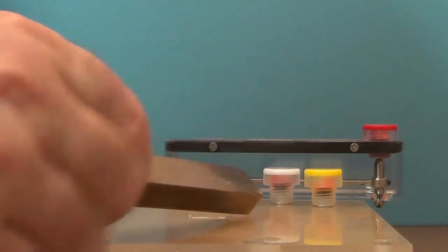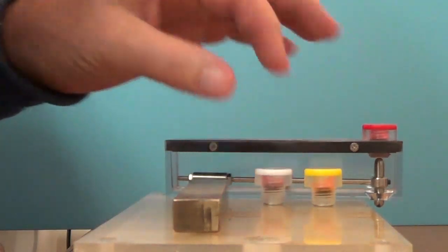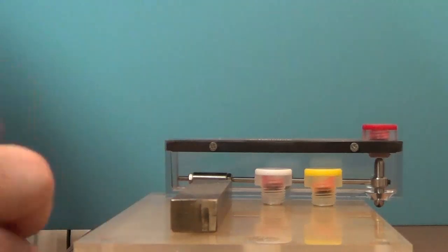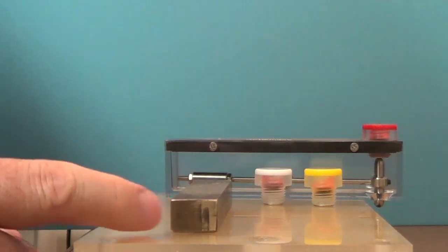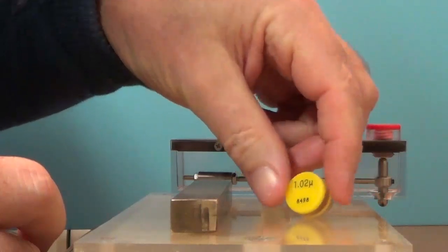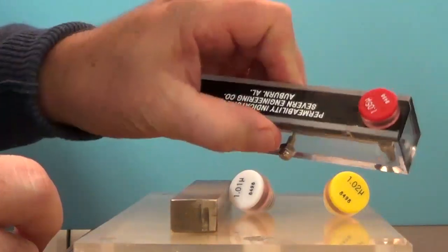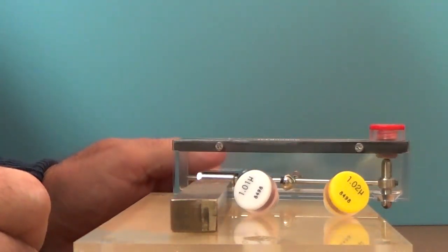I've got my sample that I'm going to try to evaluate. Ahead of time I suspect that this sample has a permeability somewhere between 1.01 and 1.05. So I've basically taken just three of the inserts out: 101, 102 and 105 that I'm going to use for testing here.